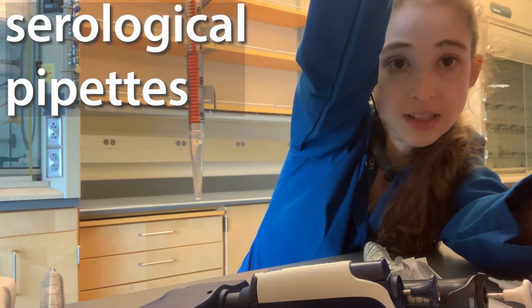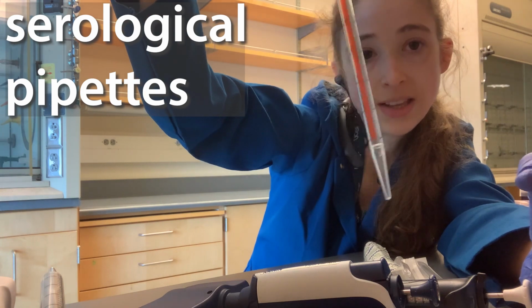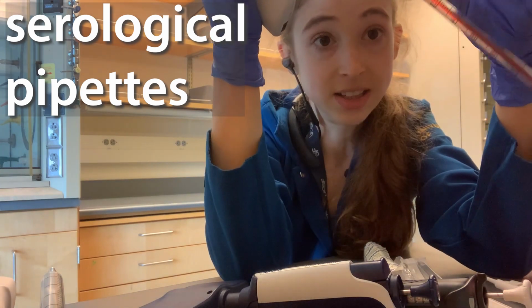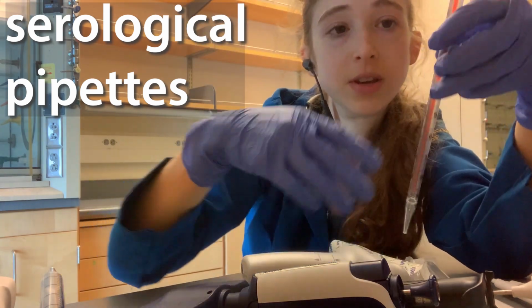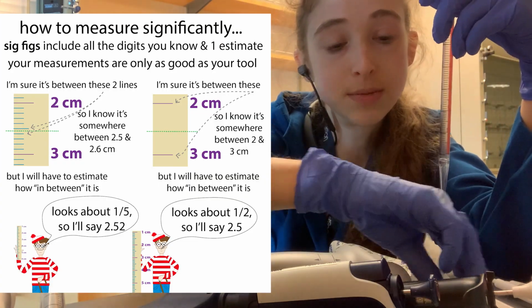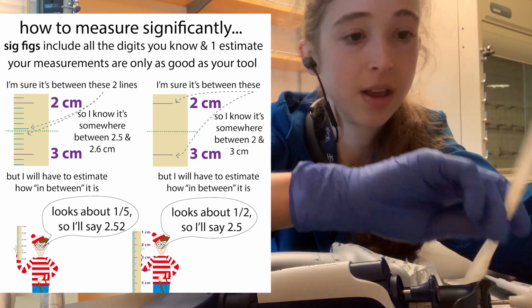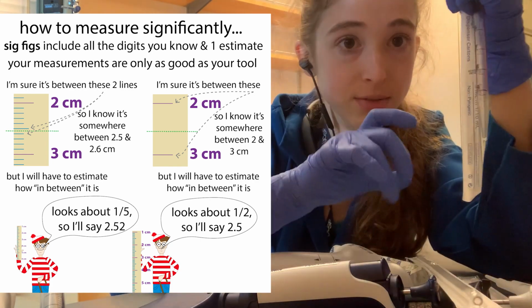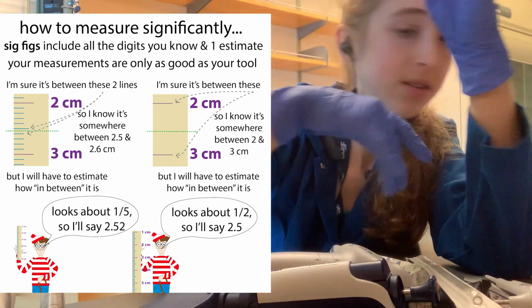If you turn this, you can see that it's going to tell you 7. So these serological pipettes have counting up on one side and counting down on the other side, which can be really helpful unless you accidentally think you're on the counting up side when you're on the counting down side, or vice versa. But you can get a much finer separation, much better precision, with one of the smaller volumes. The smaller the volume is, the finer the gradation. So a 5 mil, you're in 1 to 10 still, I guess. If you go to a 1 mil, now you have 1 to 100, although for most purposes, unless you have something that's really long, you would probably be using a P1000 if you were trying to do something like that.